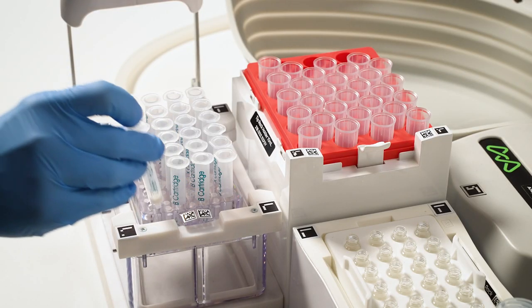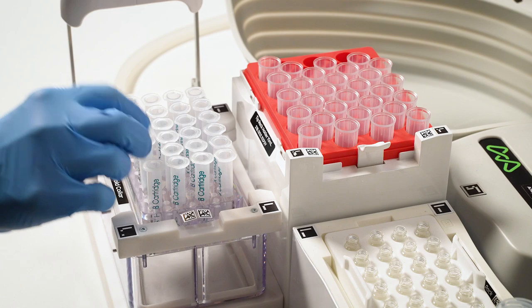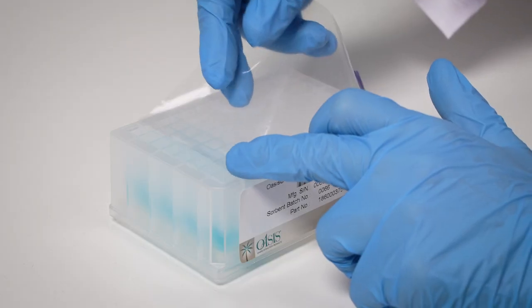While this is really practical for labs with lower throughput, air will tend to take the quickest and easiest route when a vacuum is applied. So be sure that any unused cartridge positions or wells are properly sealed. Sealing is critical to successful extractions as it will ensure that the same pressure is being applied across all positions.